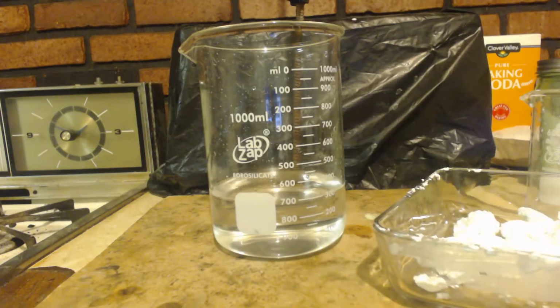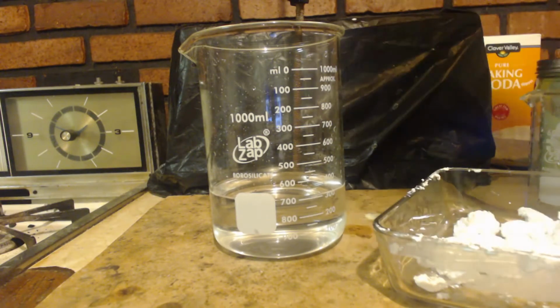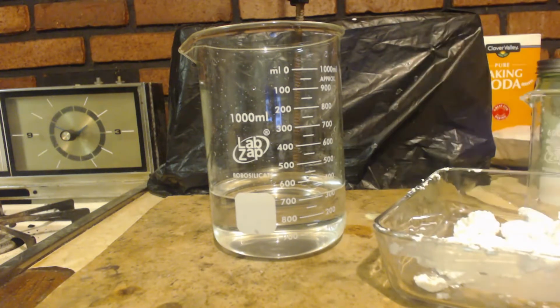Now what's left, if we took all the calcium ions out and we took all the sulfate ions out, the only thing left in there is ammonium ions and chloride ions. So the only thing that should be in solution right now is ammonium chloride. Keep in mind there might be a fifth of a gram of calcium sulfate in there too. Maybe even a half a gram. So we're not going to let all the water evaporate, but we're going to evaporate some of this water down.